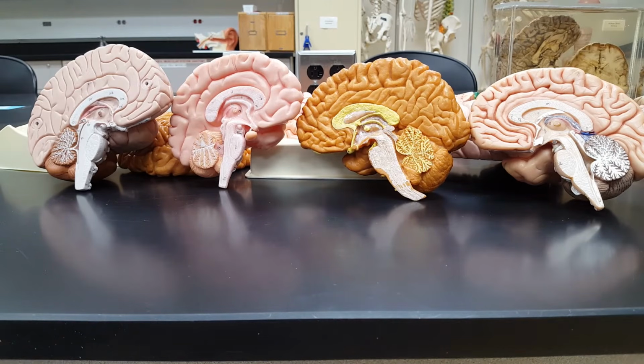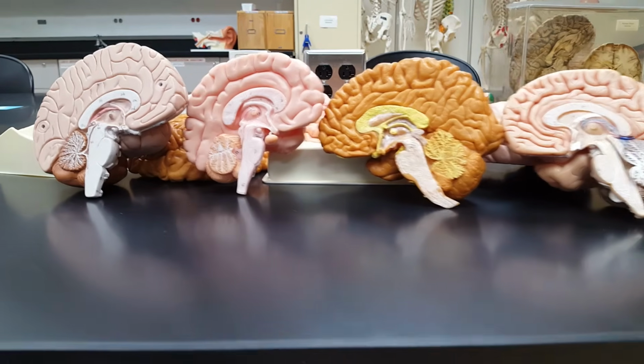So again, you're following along with me, I hope, in your lab manual. We've now reached one of Professor Allner's not so favorite names, the diencephalon. So listen very close to my instruction here so you know what you need to be aware of for your quiz and practical.